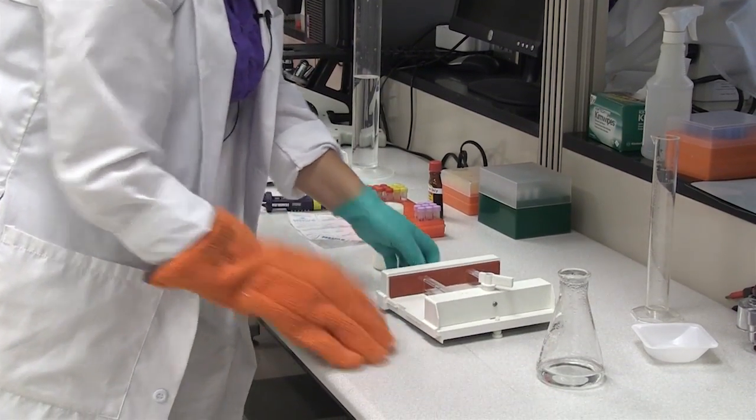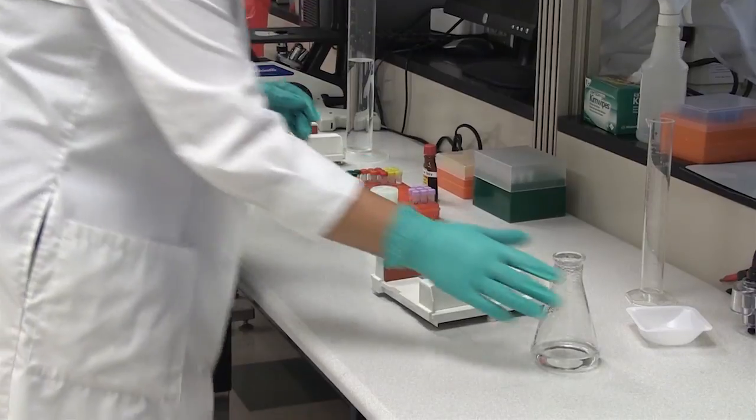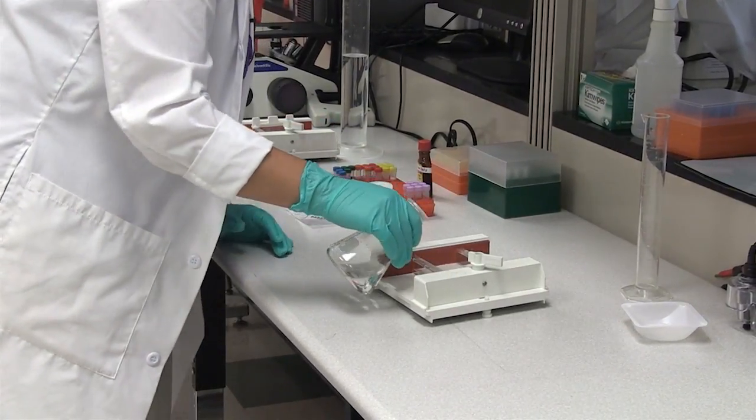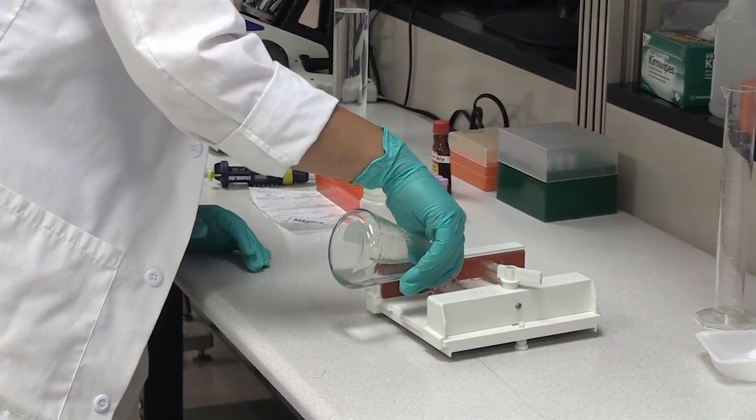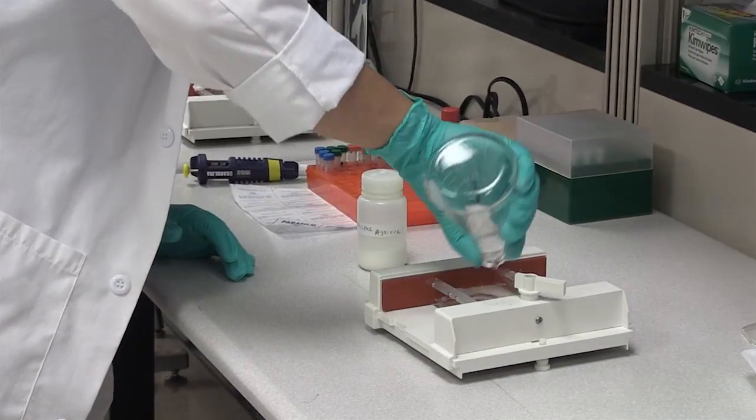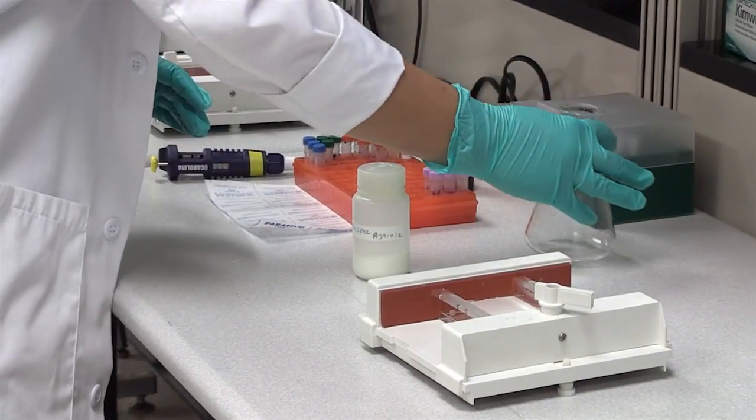So once that is nice and secure, you can take your flask of agarose and pour into the tray.